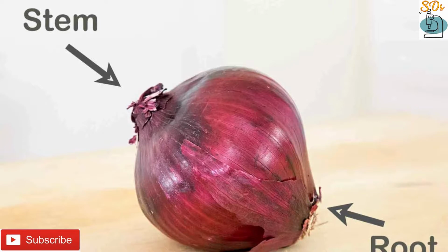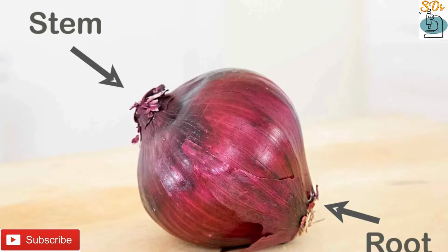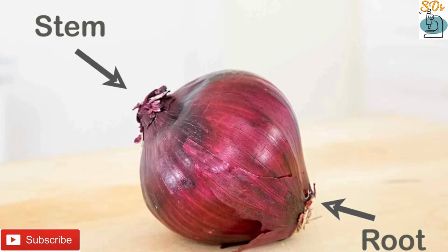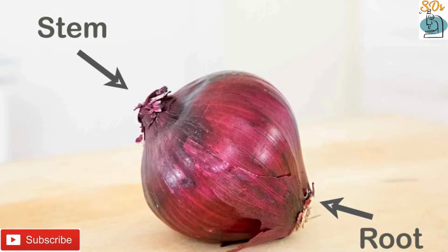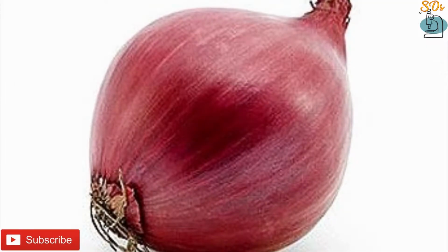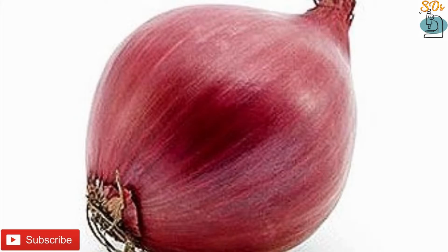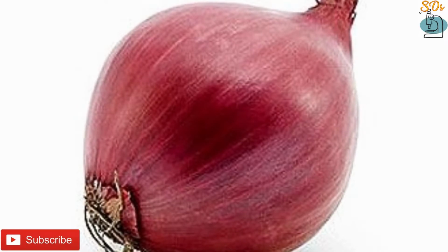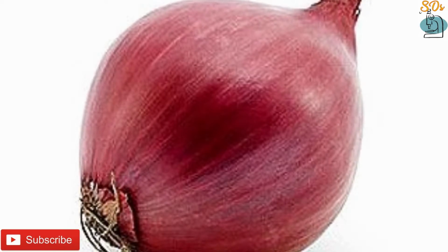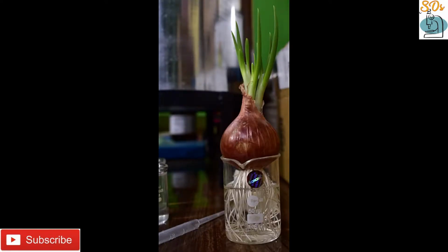What's the relation between mitosis and onion root tip? The meristematic cells located in the root tips provide the most suitable material for the study of mitosis. Onion is a monocot plant. The chromosomes of monocotyledonous plants are large and more visible. Therefore, onion root tips are used to study mitosis. Based on the kind of cells and species of organism, the time taken for mitosis may vary. Mitosis is influenced by factors like temperature and time.